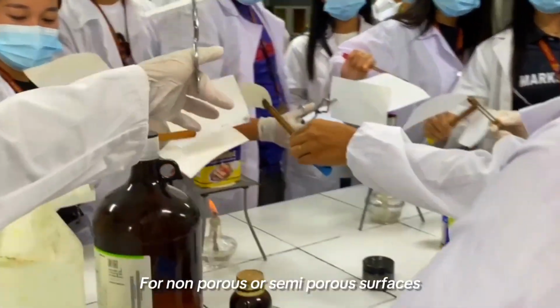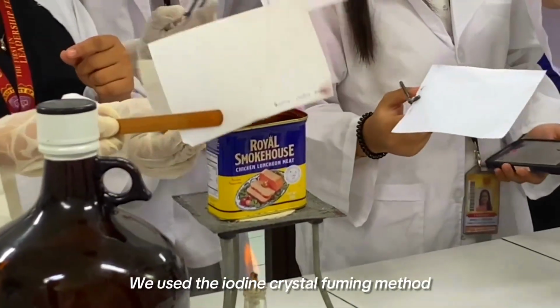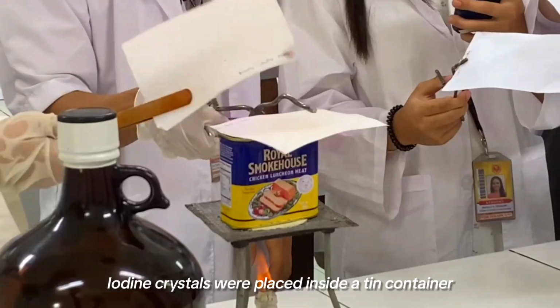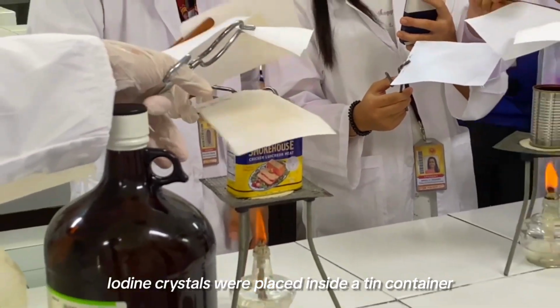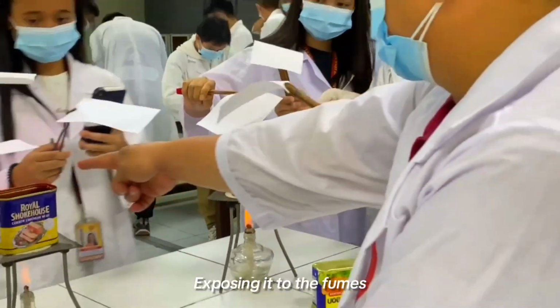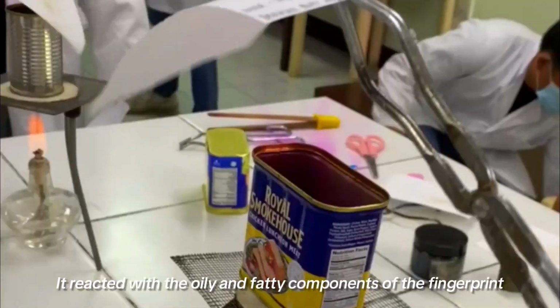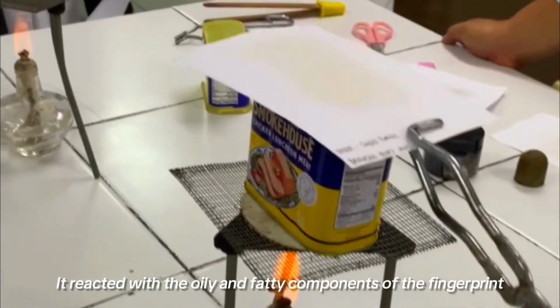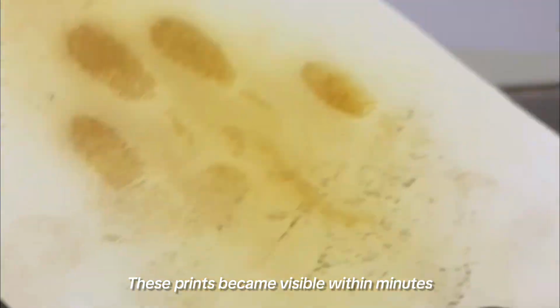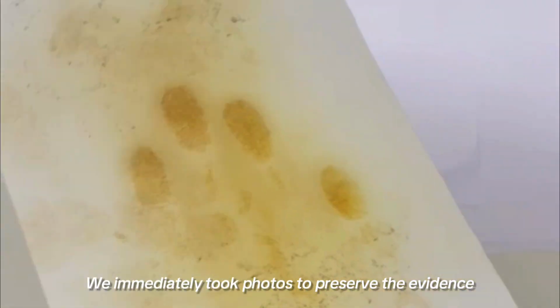Iodine-Crystal Fuming. For non-porous or semi-porous surfaces like papers or index cards, we used the Iodine-Crystal Fuming method. Iodine crystals were placed inside a tin container, and the paper with latent prints was placed over the opening of the container, exposing it to the fumes. As the iodine sublimated into vapor, it reacted with the oily and fatty components of the fingerprint, revealing brownish or yellow-brown patterns. These prints became visible within minutes, but were temporary and began fading shortly after exposure. We immediately took photos to preserve the evidence.